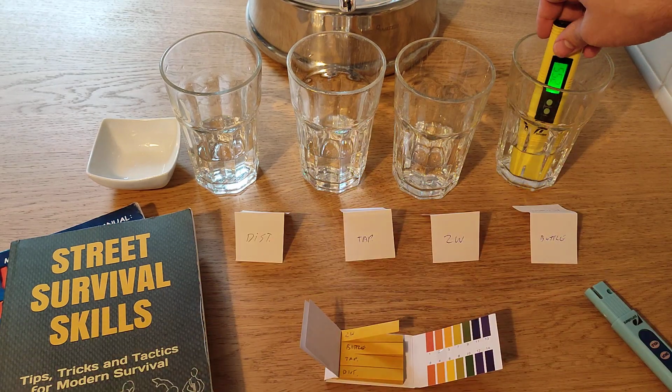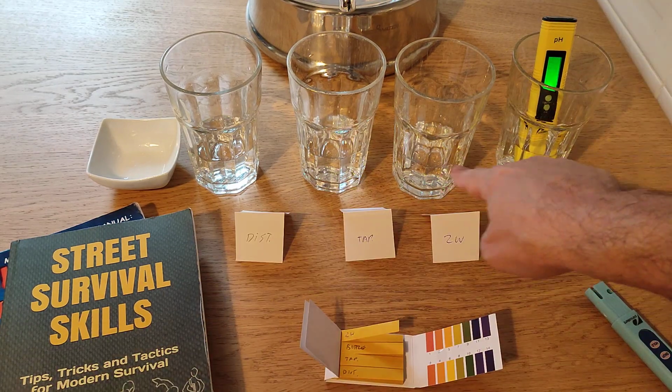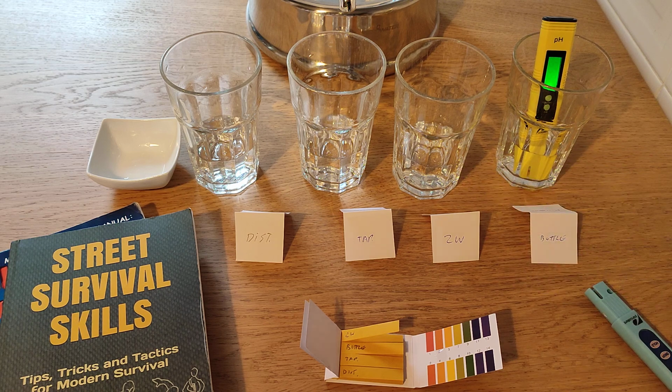What is the result that we'll have here? Again, I'm contaminating a little bit from that zero water, which is quite low, and here you see though that it goes up nicely to 6.12. This is the kind of result that you would usually expect. The standards change from one country to the other, but between 6.5 to 7 or 8, those would be the parameters that most countries have in terms of what they want in their tap water, okay?